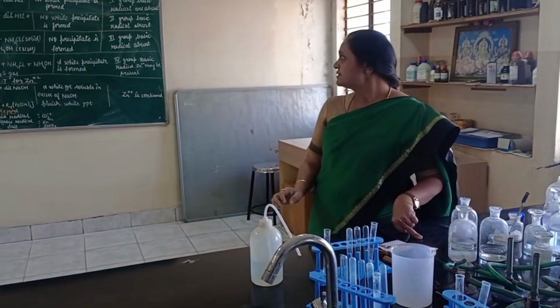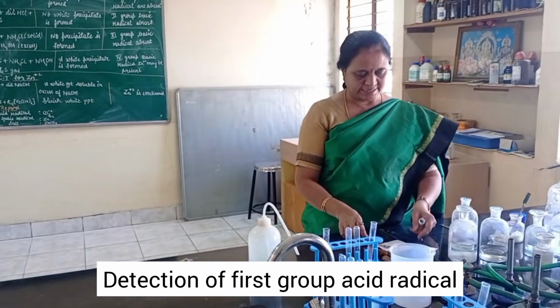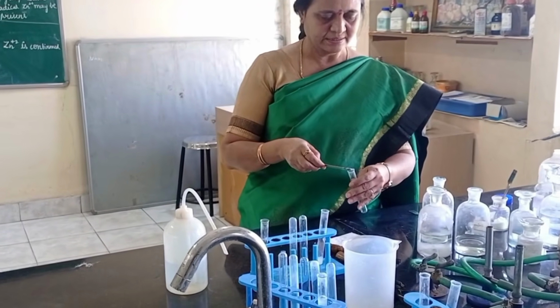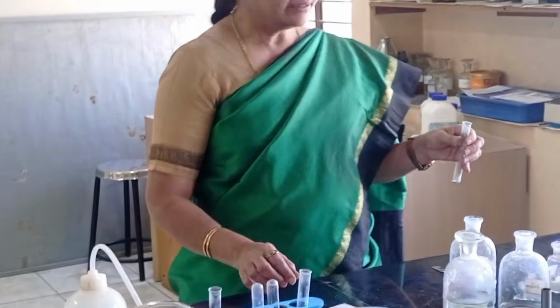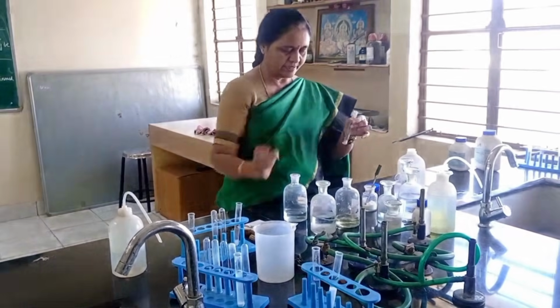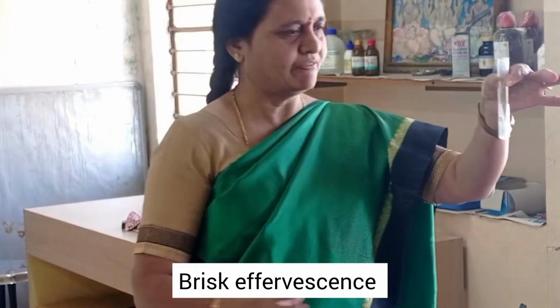Then I move to second step, detection of acid radical. First I am going to detect first group acid radical. For first group acid radical, I take salt and add dilute HCl. As here, our salt is amorphous. With dilute HCl, I am getting effervescence.